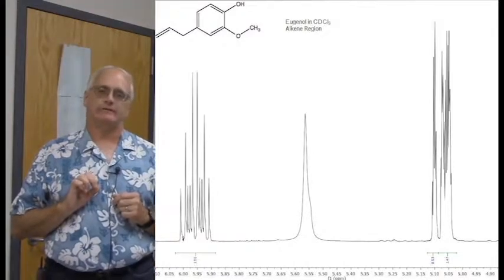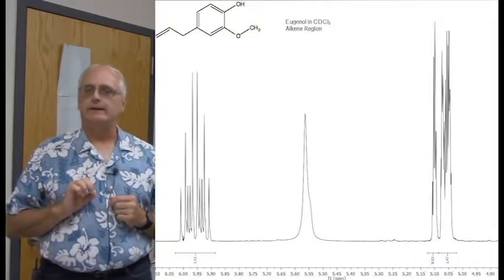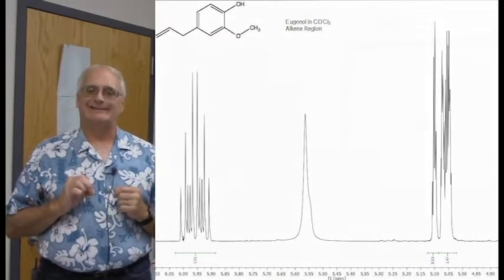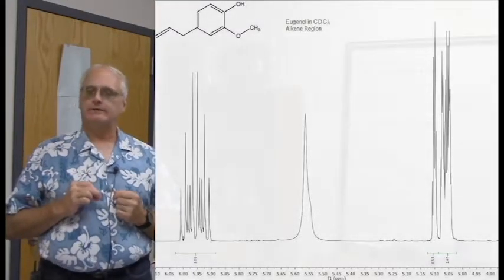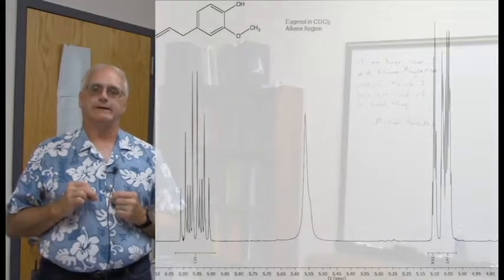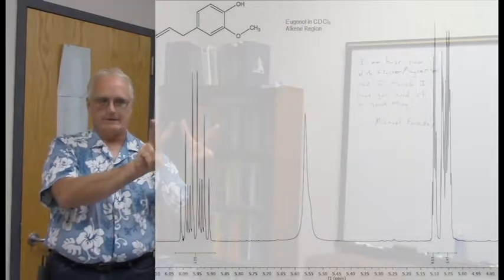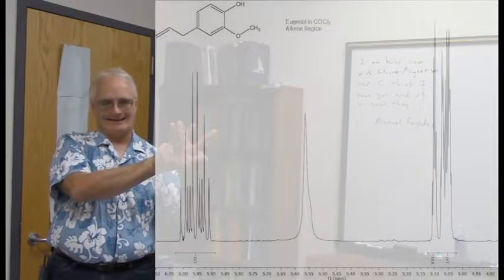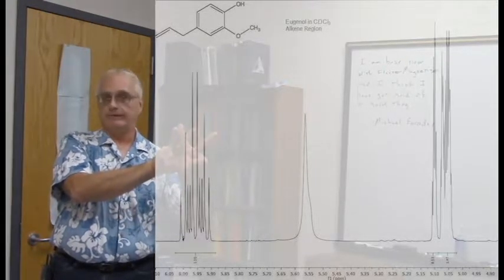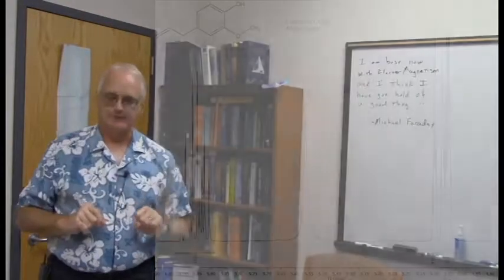And if you look carefully at the integrations, especially over here for the trans and the cis protons, now the signals are not nearly as clean as they looked in the propenol, certainly, and the pentene as well. It's a much more complicated looking thing, and we're running into overlap issues here. In fact, if you look at the integration, you notice they integrate 0.5 and 1.5. It adds up to 2, but what we have going on here is the trans and the cis, and here they are, trans and the cis. In propenol, they were nicely separated, and in the pentene, they are closer together. Now they are kind of sitting like this. And so what we have is this one integratable by itself, but it's only half of one of the signals, 0.5, and these are kind of all mashed together, 1.5. That's what's happening in this particular case.